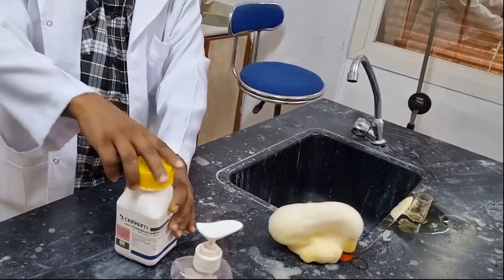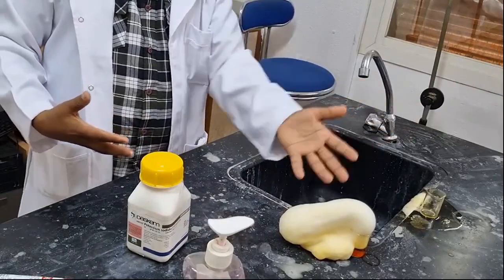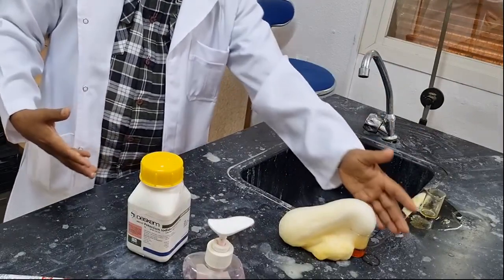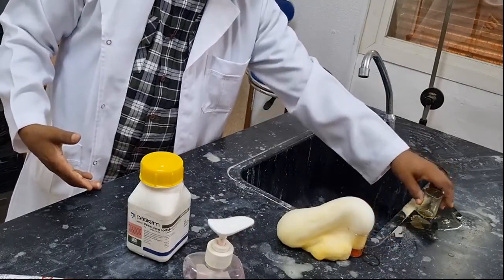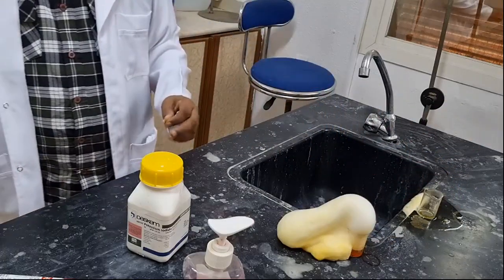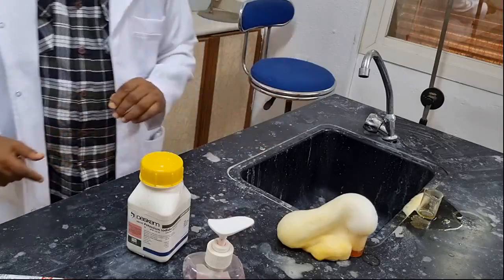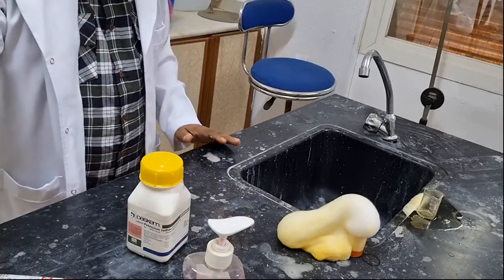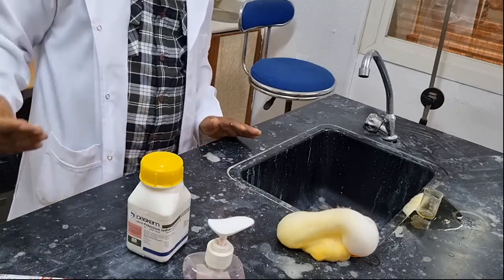Okay, therefore, this is the decomposition reaction taking place. Totally, the idea is decomposition of hydrogen peroxide with the help of the catalyst, potassium iodide. In both cases, one contains liquid detergent. The reaction is exothermic. If you are able to touch it, this one is very hot. The beakers are very hot now because the reaction produces a great amount of heat energy. This is an exothermic type of reaction. This is the observation and demonstration for this class.